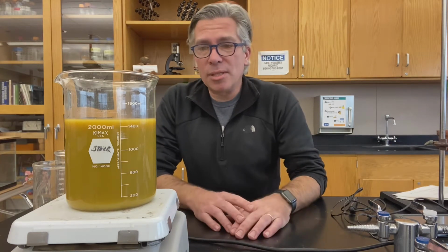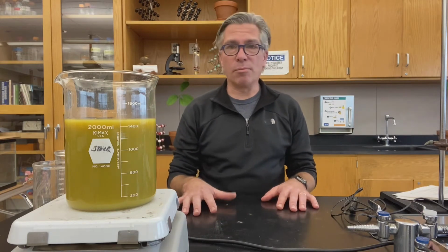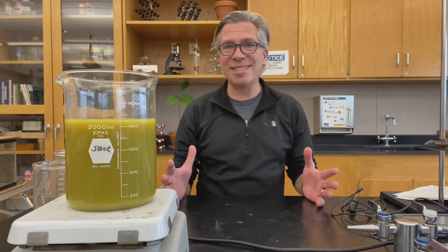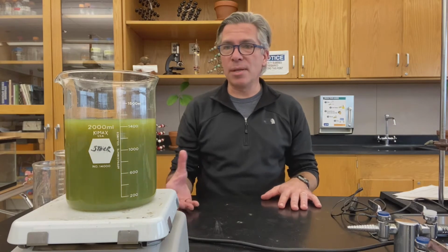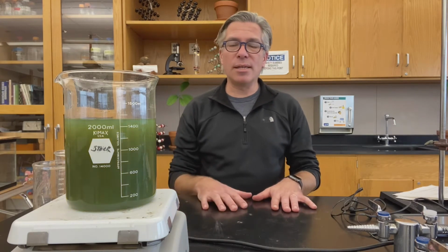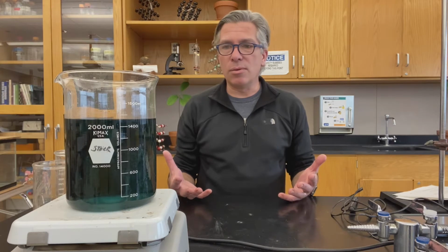In the meantime, let's talk about oscillating reactions. Oscillating reactions were discovered back in the 1800s. This is actually one of the classic, I'm gonna say the name wrong, Belousov-Zhabotinsky. I'm sure I said that wrong. But there are 2 Russian chemists and they discovered that mixtures that contained bromate, bromide, malonic acid, or even any other equivalent carboxylic acid. Ooh, did you see that?